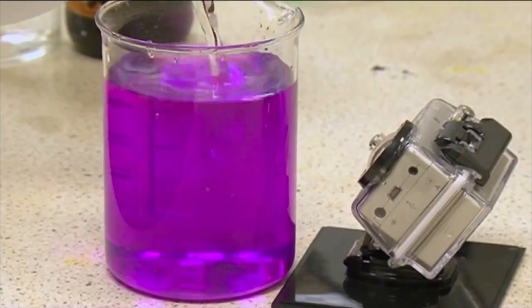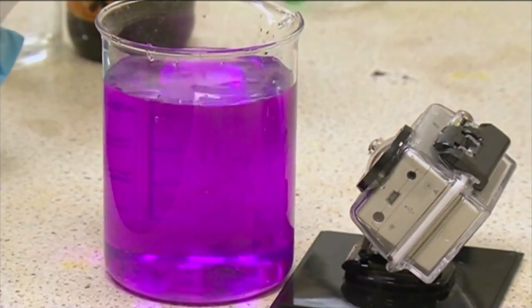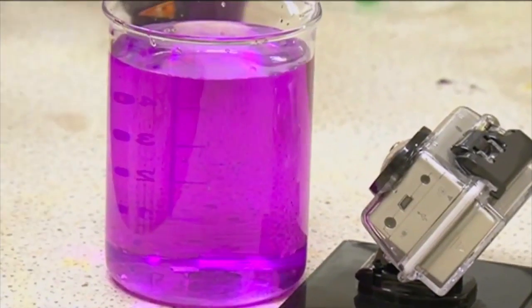I think it may be flat. I'll try another bottle. I'll get some of my own hydrogen peroxide instead. Gone flat? Yes. Well, hydrogen peroxide can decompose into oxygen and water, and if you keep it too long, it goes off. So I get some more. There isn't very much of it, but perhaps this will be enough.